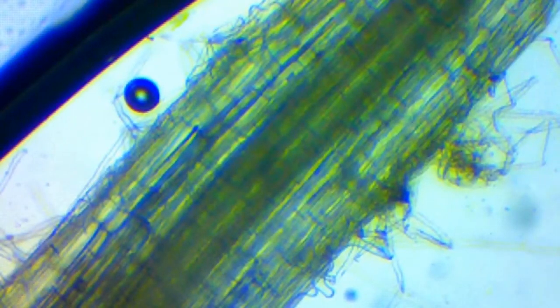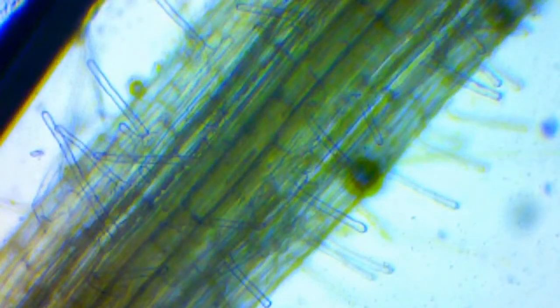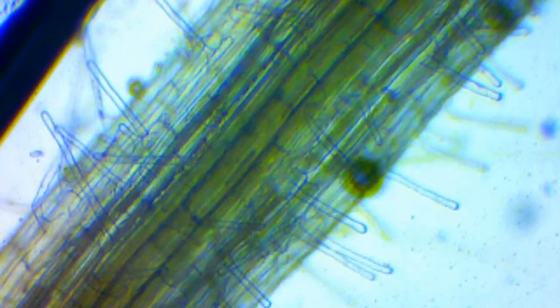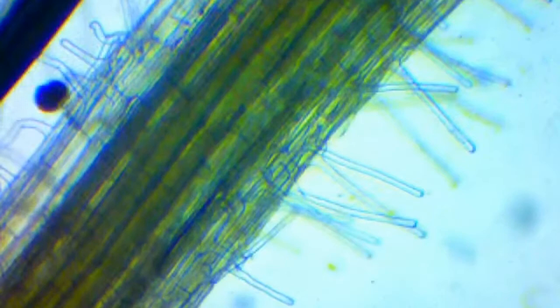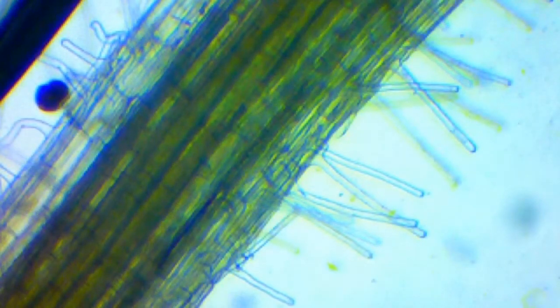This is grass. And if you've ever pulled grass out, if you've ever tried to pull one blade of grass out, it's got like one long root, or it looks like it is, but look at this. There's little teeny tiny hair-like projections coming out that help hold it into place. Let me see if we can get the focus here. There they are. Look at that. Isn't that cool? So they are all the way around the root, and they're helping to anchor it into the ground. Super cool.